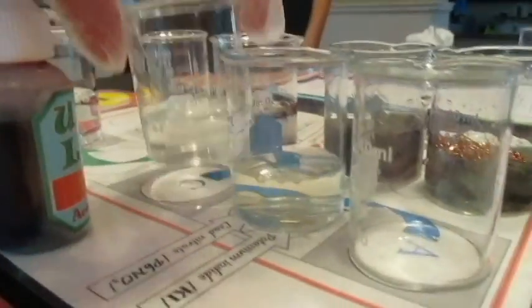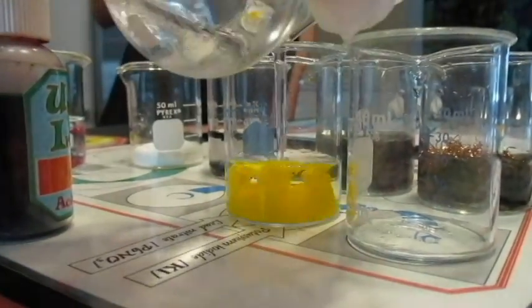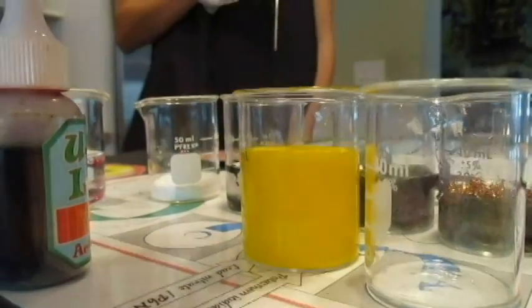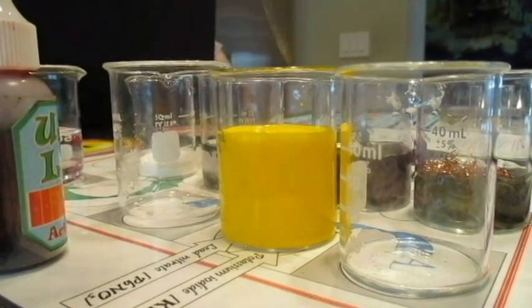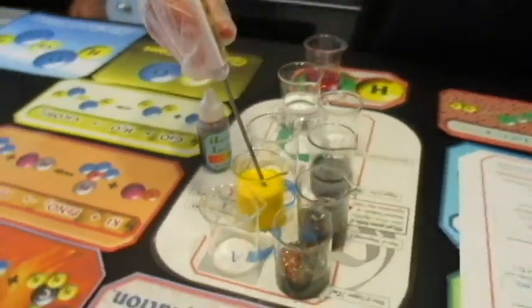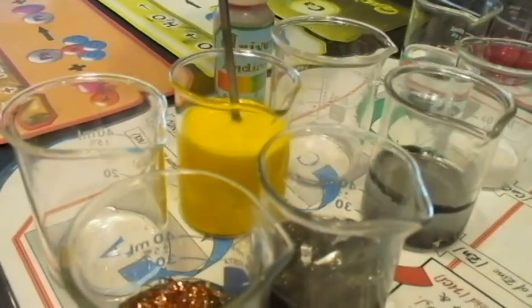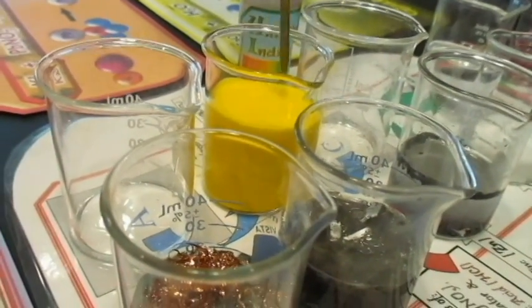And now she's going to add beaker C. So she put the potassium iodide in there. Notice it's clear. And now she's pouring in the lead nitrate. Whoa. Do you see any signs of a chemical reaction? Yes. Get a temperature. It happened right away. Some reactions don't mess around. Some reactions are instantaneous, right? So 24.4 Celsius. Okay, just give it a second. It has to adjust. But 24.4.